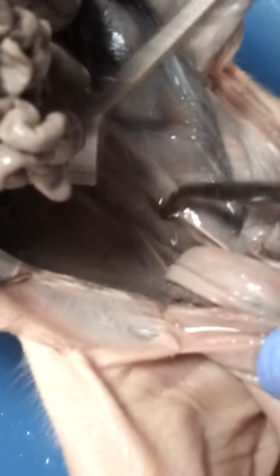And then we go on to the rectum, which is this. Wait, let it focus. It's not focusing. Rebecca was our camera person. Okay, it's right there if you can see it. Right there, yeah, that is the rectum. And that has the food traveling from the large intestine to the anus, which is the hole, and which is right over here. It comes out there.